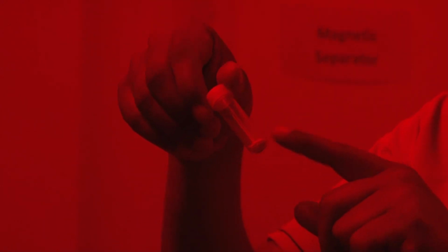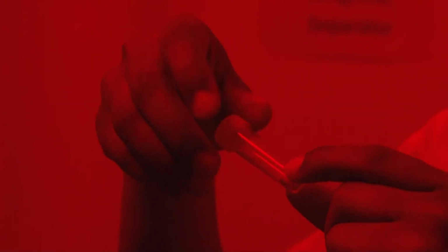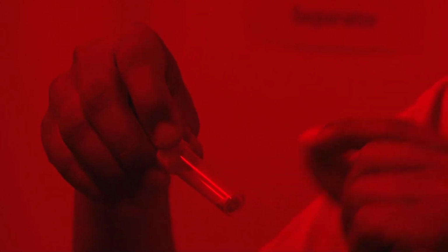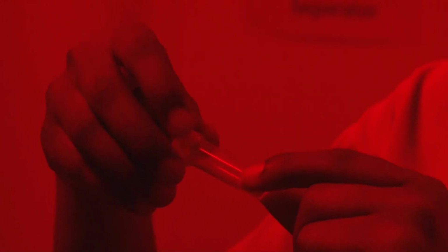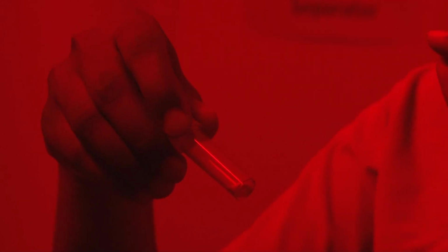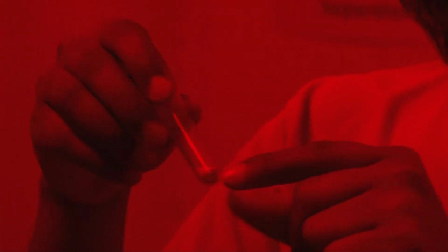Here you can see this is the pure quartz, and for checking the purity you can keep this quartz on the microscope and see the grains of the quartz. The grain size of this quartz is 90 to 125 micron. When you are doing the HF treatment, the outer skin is removed from the grains, so the size will also decrease. So you have to again do the sieving.